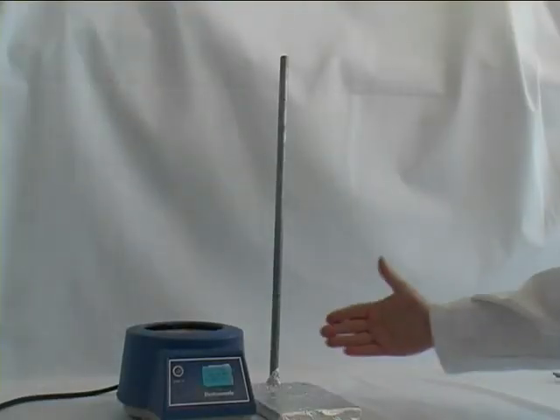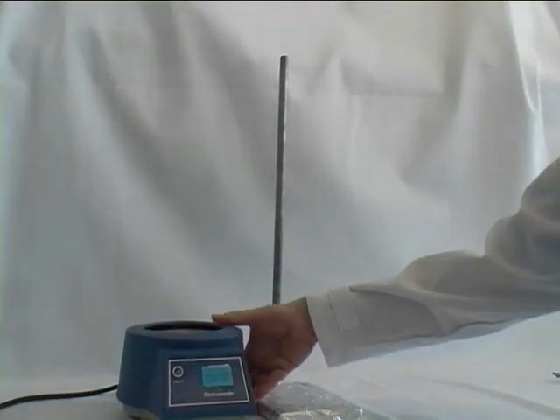Welcome to the Dean & Stark apparatus video. This is a video where I will demonstrate how to set up a Dean & Stark apparatus.